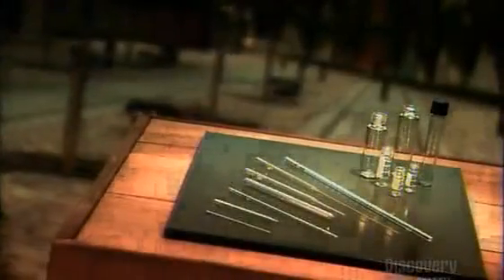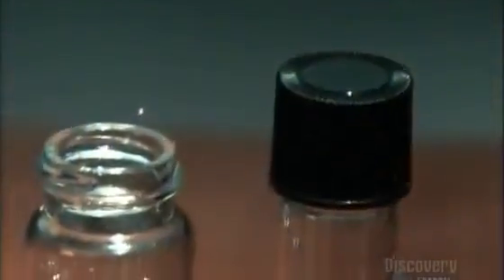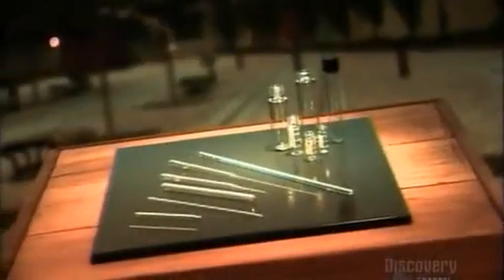Their size, shape, and function run the gamut, ranging from beakers and test tubes to petri dishes and vials. Mixing, measuring, storing, or sampling is all in a day's work for a piece of laboratory glassware, built to withstand even the most potent of chemical concoctions.